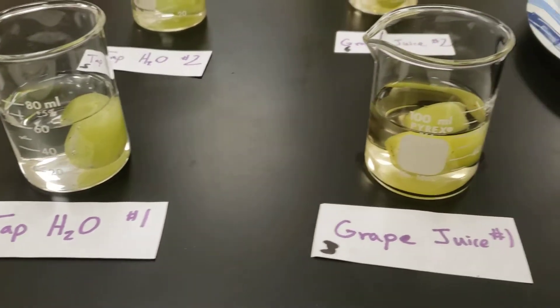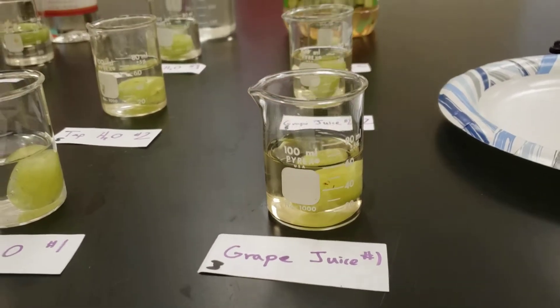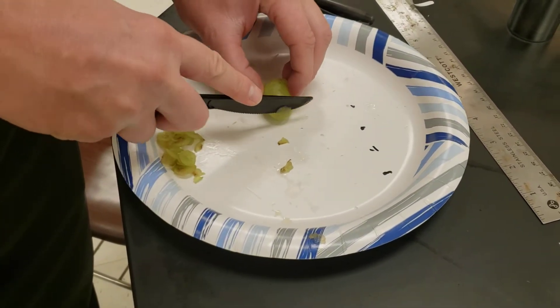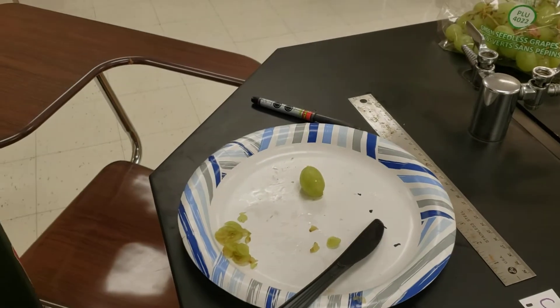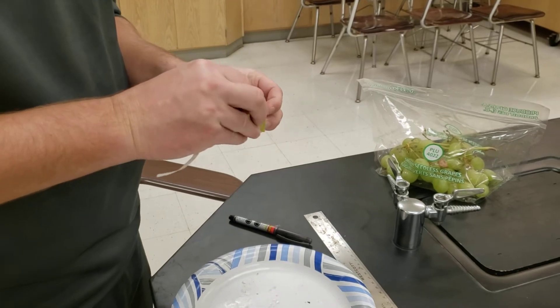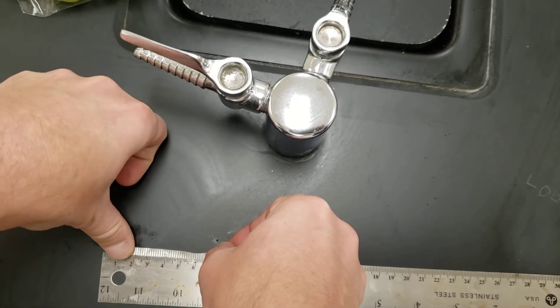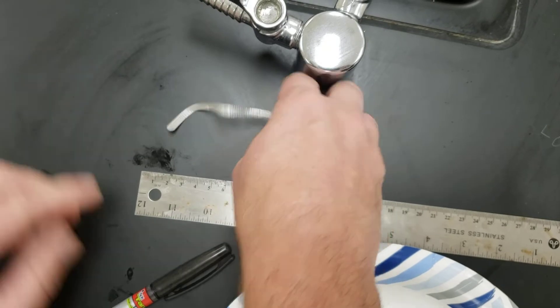I'm going to model exactly how we set this up to help you write your procedures. For each grape, we cut a little bit to enable more surface area for transport to take place. To measure the grape, we took a simple ribbon, wrapped it around, and held it up to the metric side of the ruler — because we do not use customary units in science. That came out to about 7.2 centimeters.